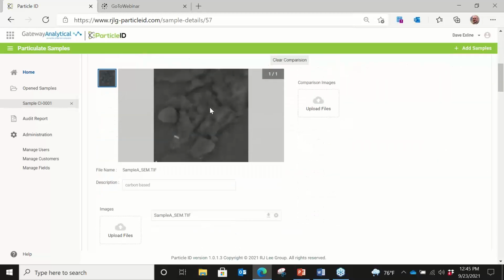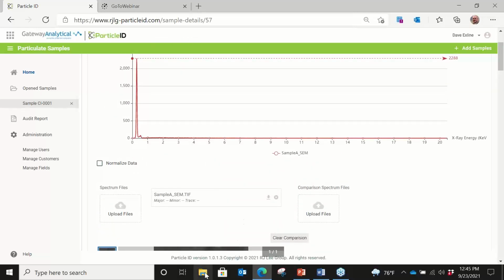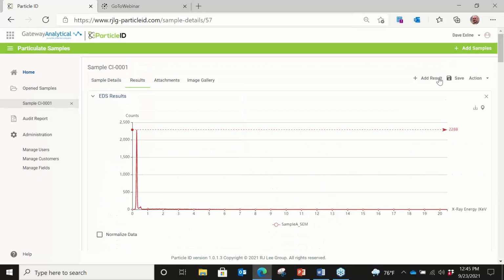We also have electron microscopy images that can be uploaded, and they are as simple as opening up a file and just dropping it into this upload files portion. And then that would add a new sample to the thing, and you just hit save.